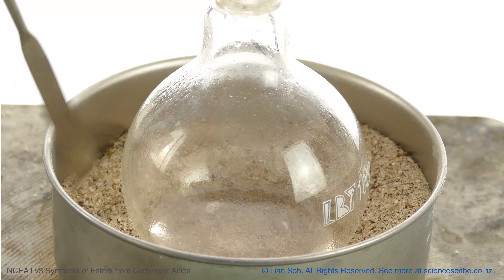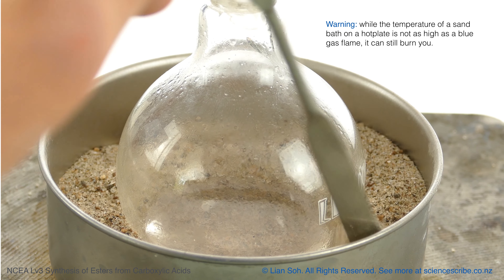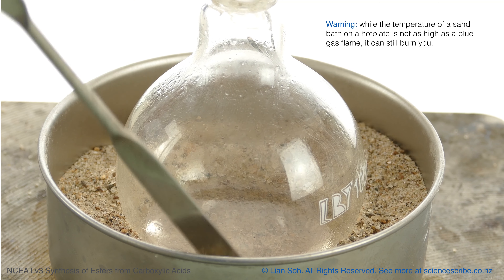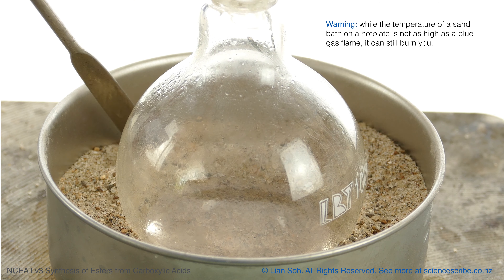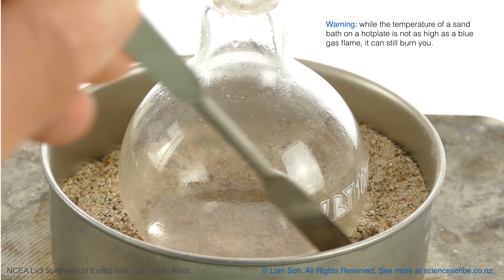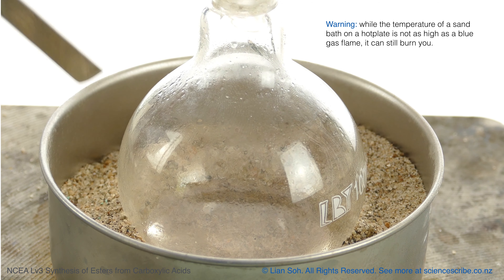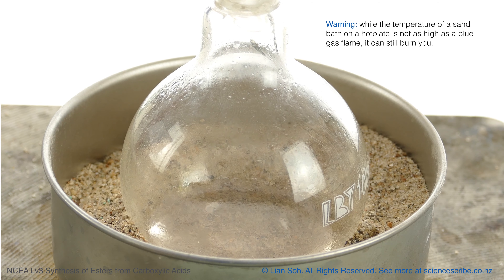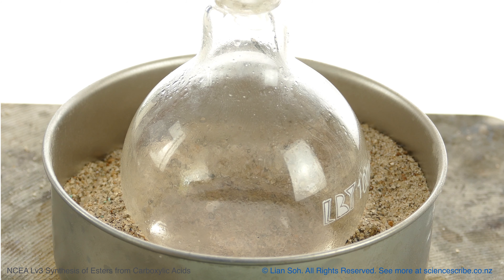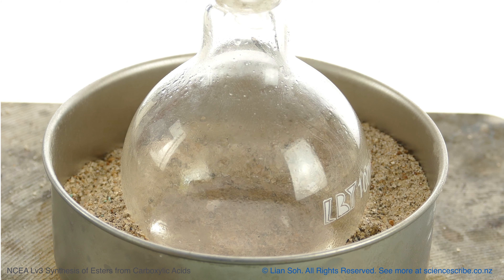We're going to bury this flask into a sand bath and apply heat from the bottom to ensure it's evenly distributed. Don't be deceived by the sand into thinking it's cold — it's actually still really hot.